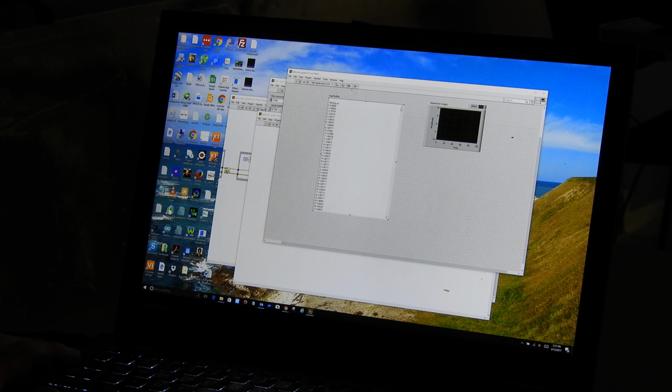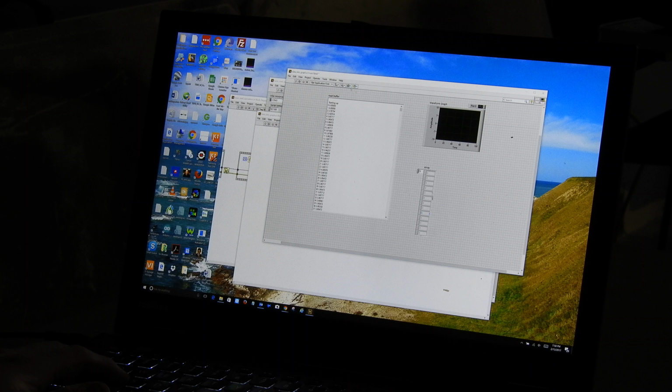I'm going to go to the front panel, and I'm going to make an array. Okay. And then I'm going to take a numeric control, and I'm going to drop it in there. Now I have a one-dimensional array of numerics. And now I'm going to go further and set the data type to be a single precision floating point. Actually, I'm going to go with double precision floating point, double. So I'll make sure it's a double. I think a double is a 64-bit floating point number. I would have to reference that to make sure.